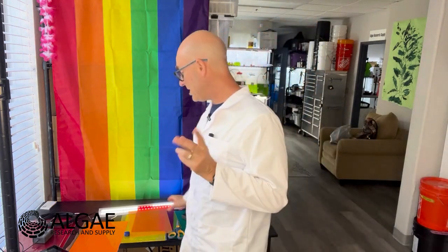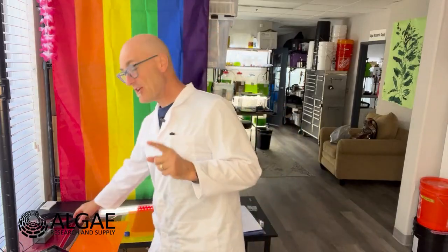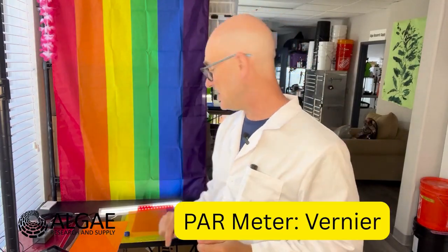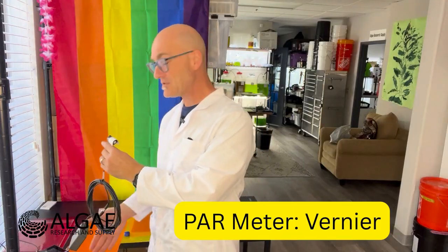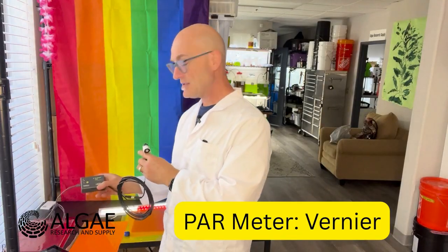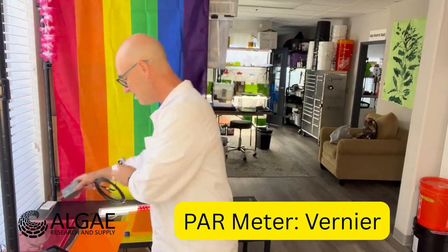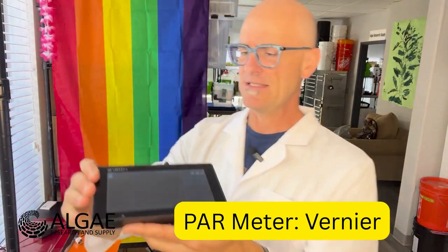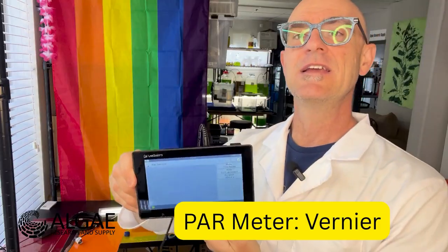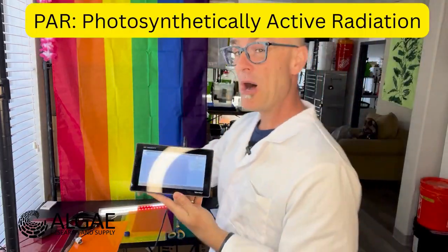Finally, the one thing that we really want to do to make sure that we're giving the same amount of light, the total flux of photons at each individual one of these wavelengths here, we're going to use a spectral or a photometer. This is measuring PAR. These are from the fine people over at Vernier, and we have one of their little devices here. This is their LabQuest. So we have the PAR meter here.